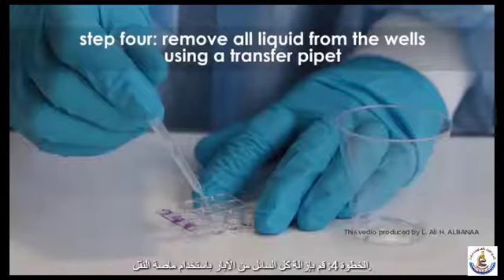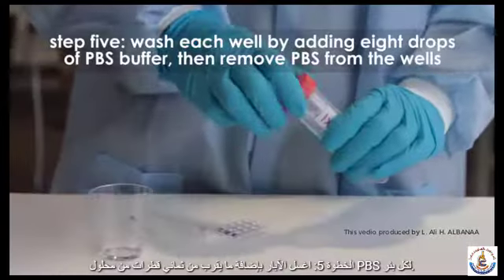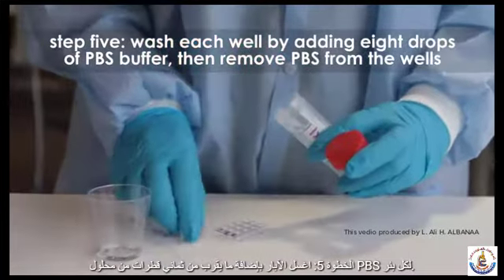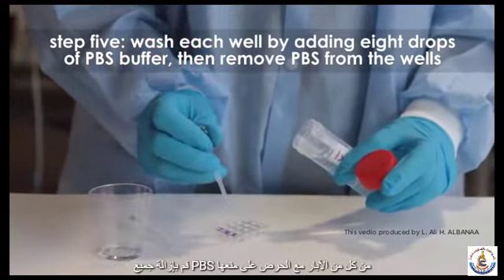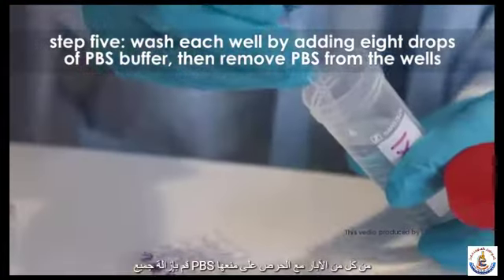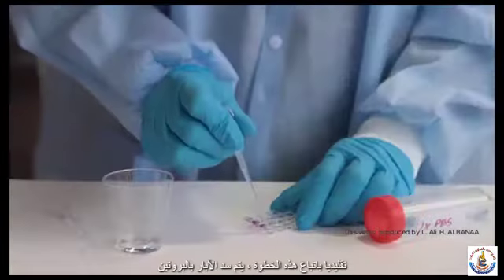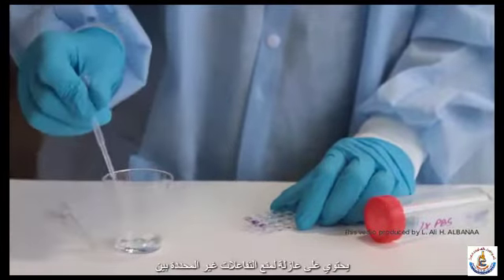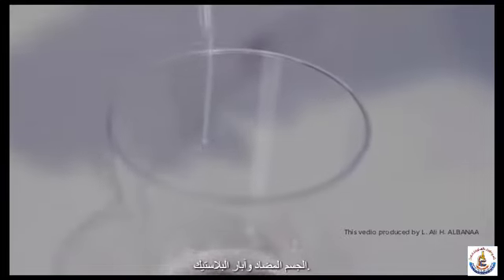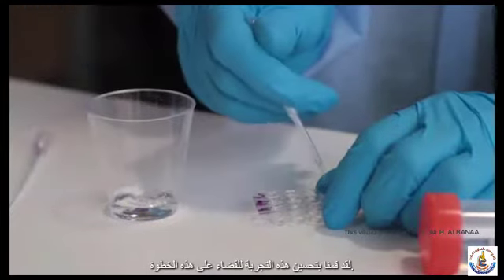Step 4. Remove all the liquid from the wells using a transfer pipette. Step 5. Wash the wells by adding approximately 8 drops of PBS buffer to each well. Remove all the PBS from each of the wells, taking care to prevent the buffer from spilling over into adjacent wells. Traditionally, following this step, the wells are blocked with a protein-containing buffer to prevent non-specific interactions between the antibody and the plastic wells. We have optimized this experiment to eliminate this step.